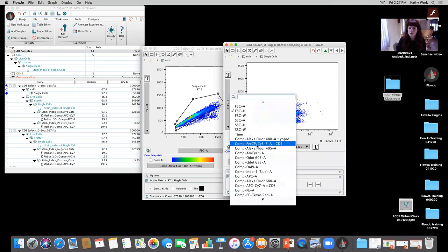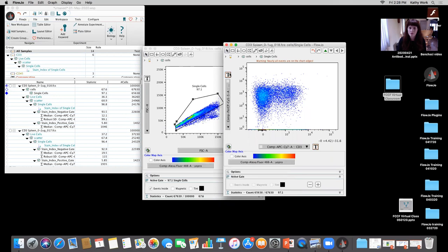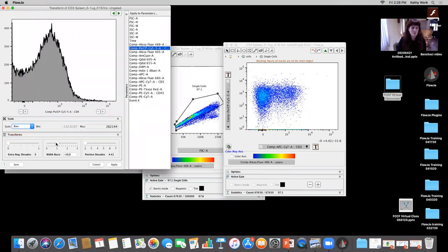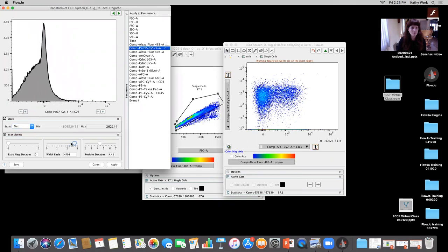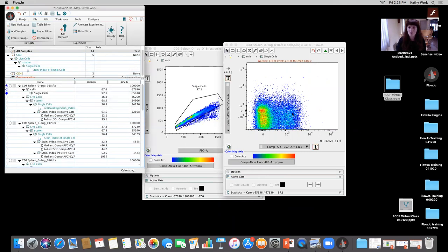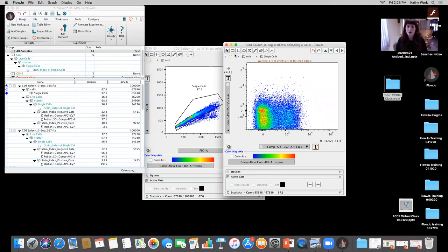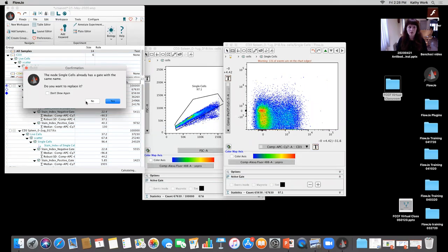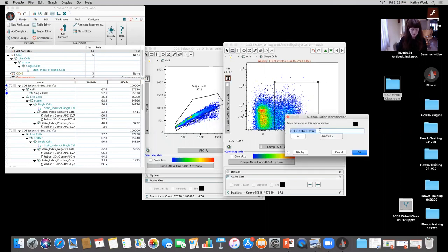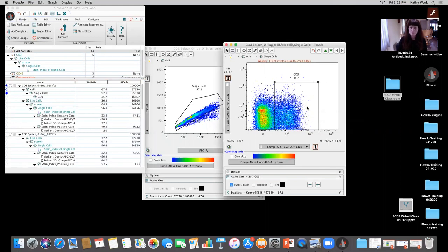I'll look at it versus the CD4 detector. Look at it. There, okay. And this actually does have a little bit of an issue with compensation, right here. That's a separate discussion that we just went over. And I'm going to go ahead and use this. I'm going to gate where I believe my CD3 are.